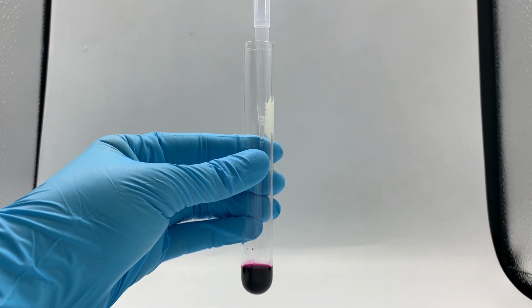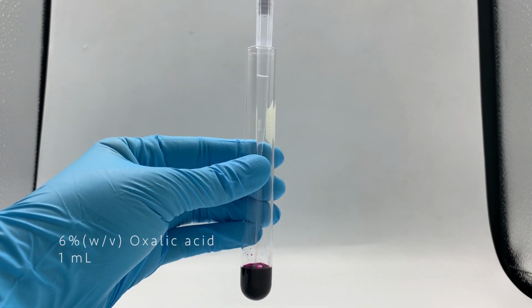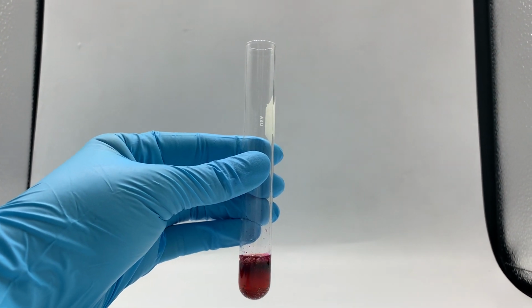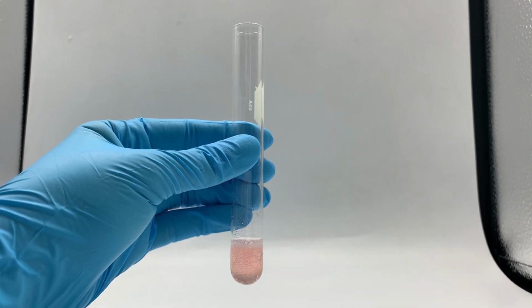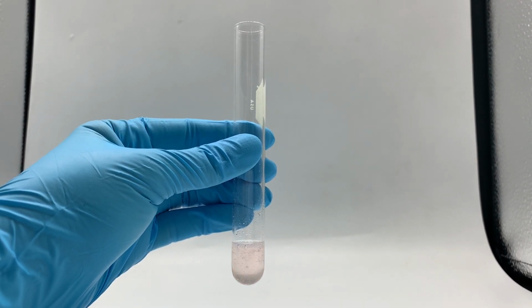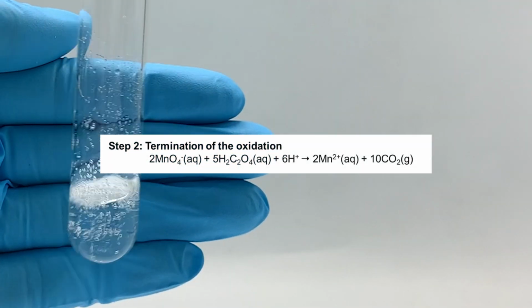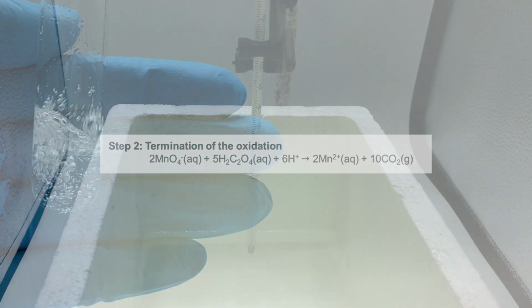After that, to stop the oxidation reaction, 1 ml of oxalic acid is added in the vial and swirl for 1 minute to eliminate the oxidizing agent. The color will turn to colorless. This step is called termination of oxidation.